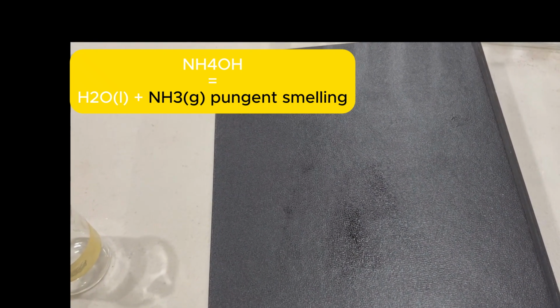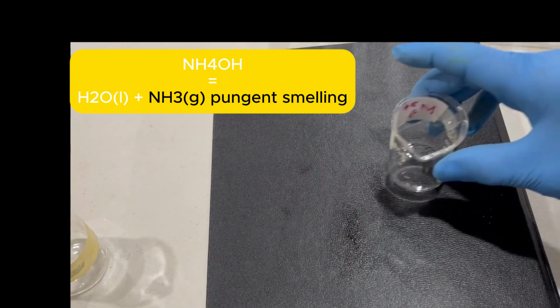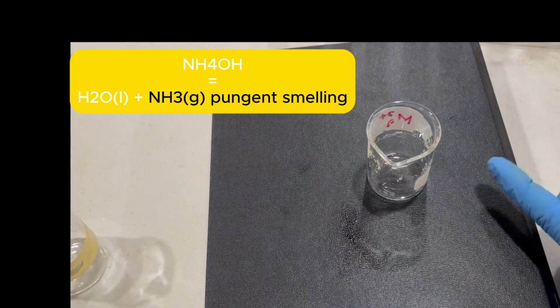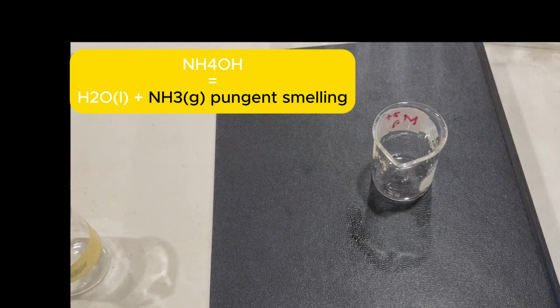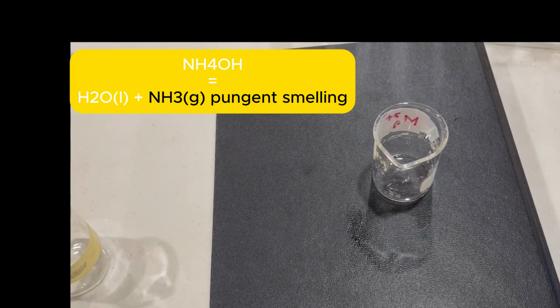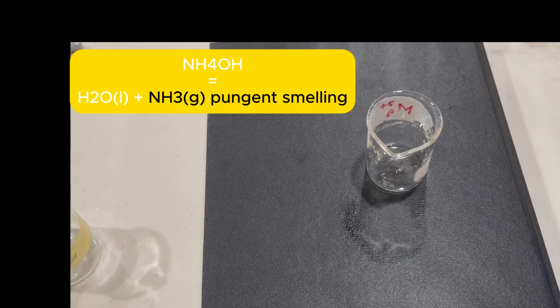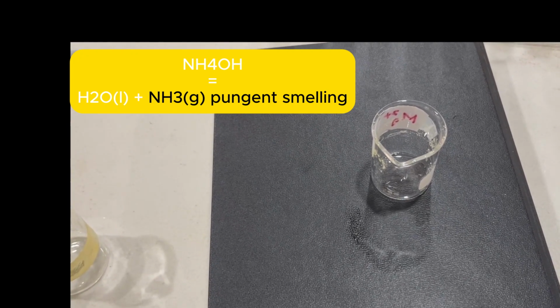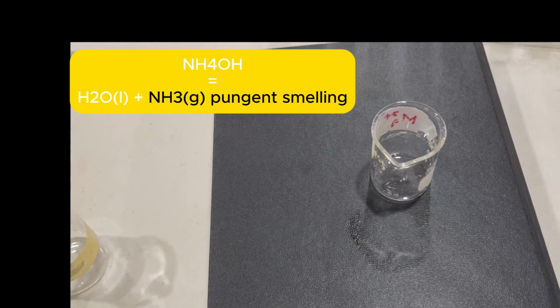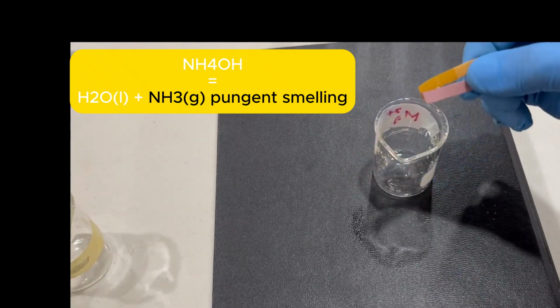We can check for the liberation of ammonia gas by inserting indicator paper there. Ammonia is a pungent smelling gas that turns pink litmus paper blue, or it changes the color of pH paper. So we check both of them out and see what will happen. We'll damp these. These are the colors of the papers before.